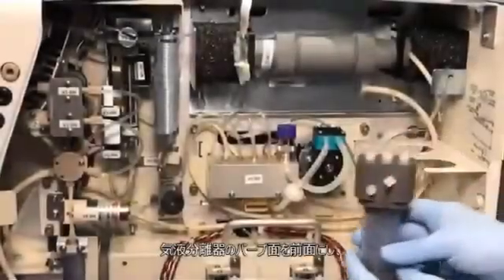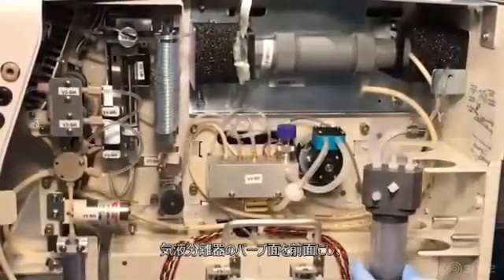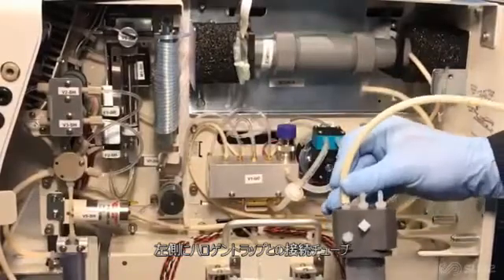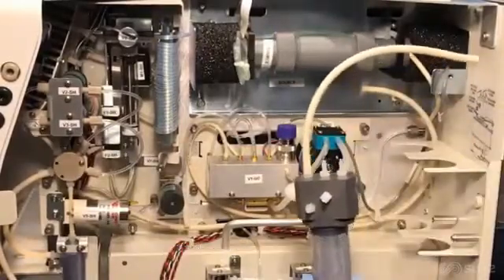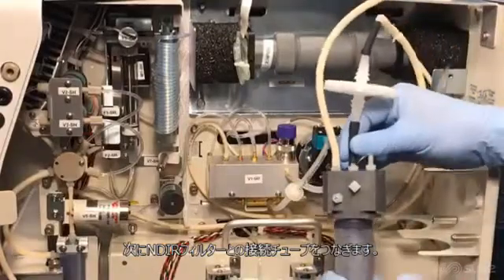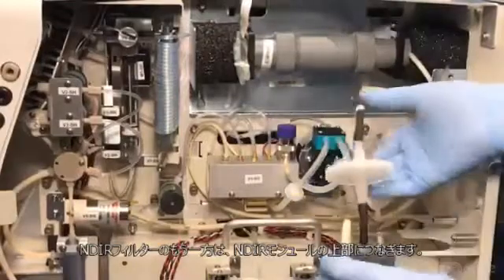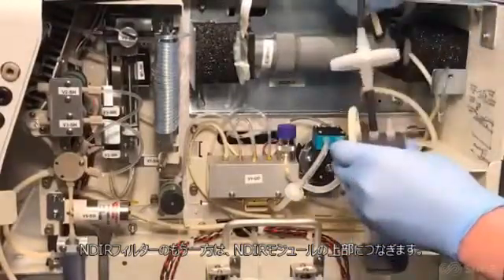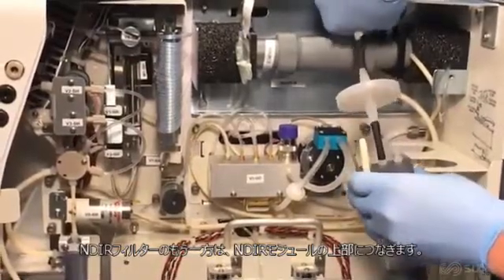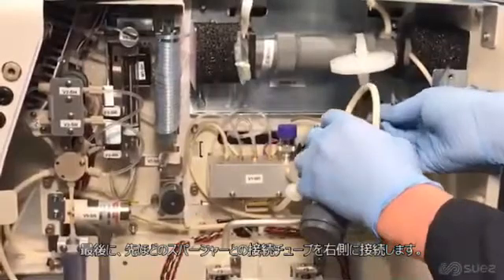Make sure the barbs on the front of the gas-liquid separator are facing forward. Starting on the left, connect the section of tubing that extends to the top of the halogen trap. Next, connect the section of tubing with the NDIR filter to the center barb. Connect the free end of this section of tubing to the barb on top of the NDIR detector end cap. Connect the remaining section of tubing extending from the sparger to the barb on the right.